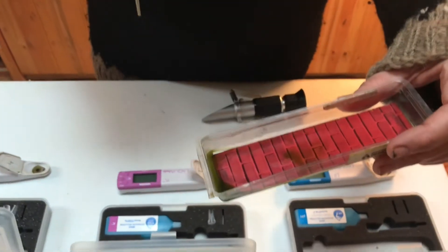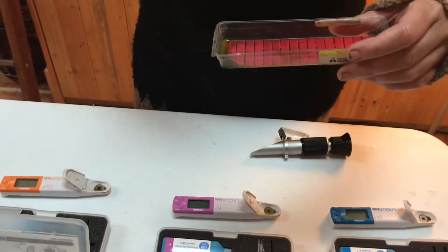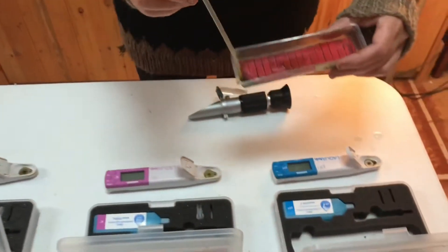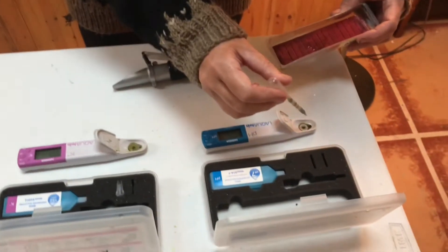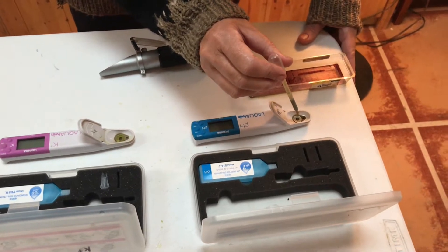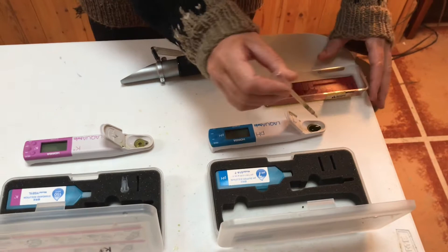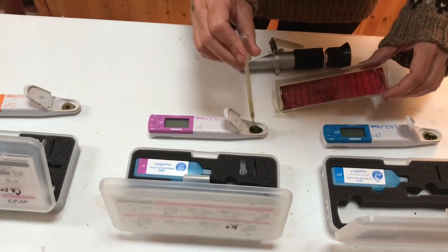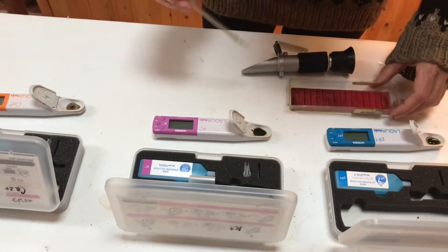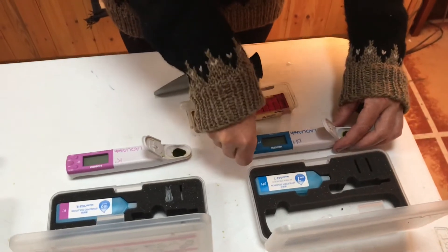This is the sap that Oliver has pressed from the leaves — this one is cocktail grapefruit old. We're going to be measuring it with the Horiba meters. Add a few drops, making sure they cover both electrodes, and a few drops on the next one. Sometimes you have to share the drops around because you won't have enough sap to go through all the instruments. Turn them on — really important.